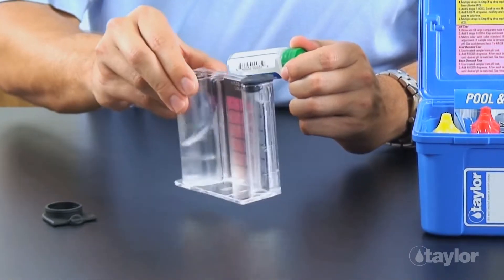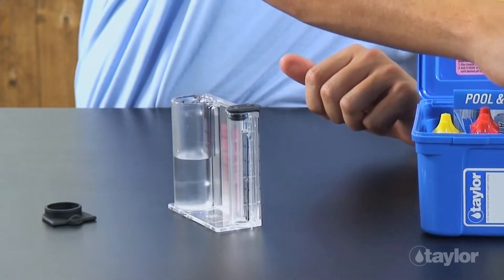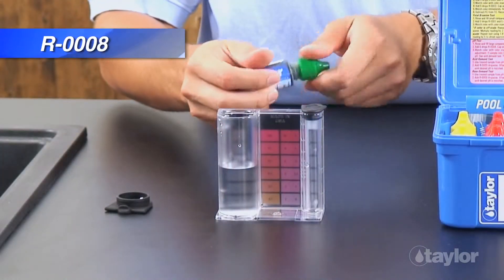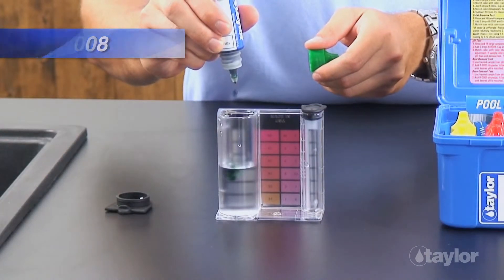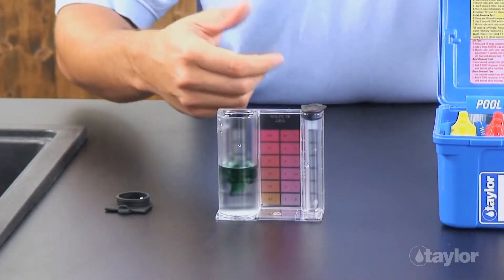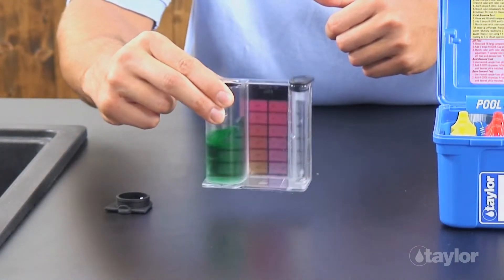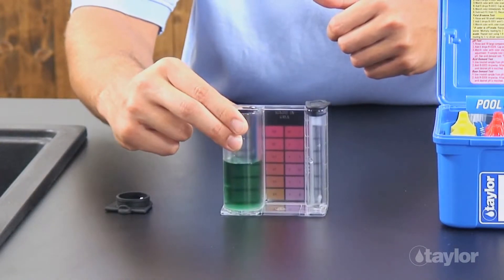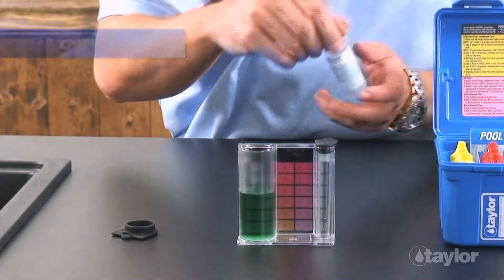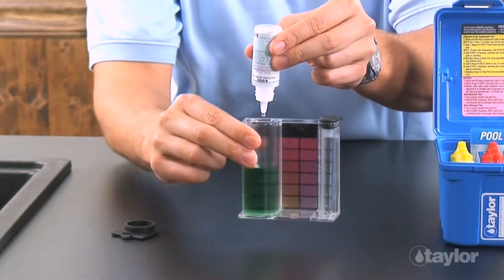Swirl to mix. Add 5 drops of reagent 8 indicator. Swirl to mix. The sample should turn green. Add reagent 9 dropwise. After each drop, count and swirl to mix until the color changes from green to red.